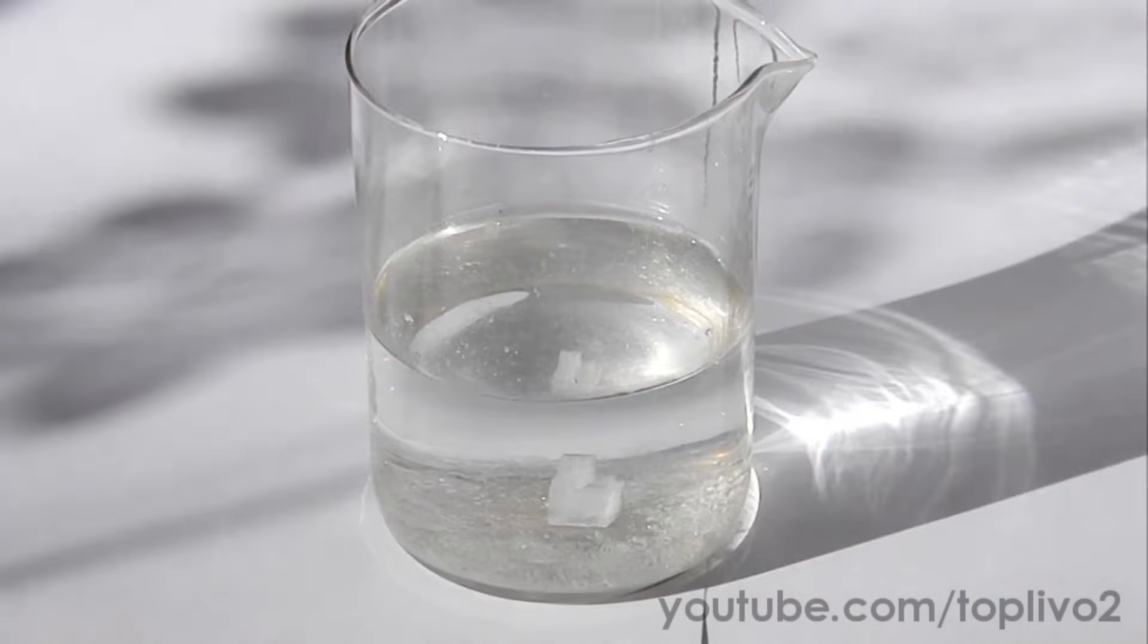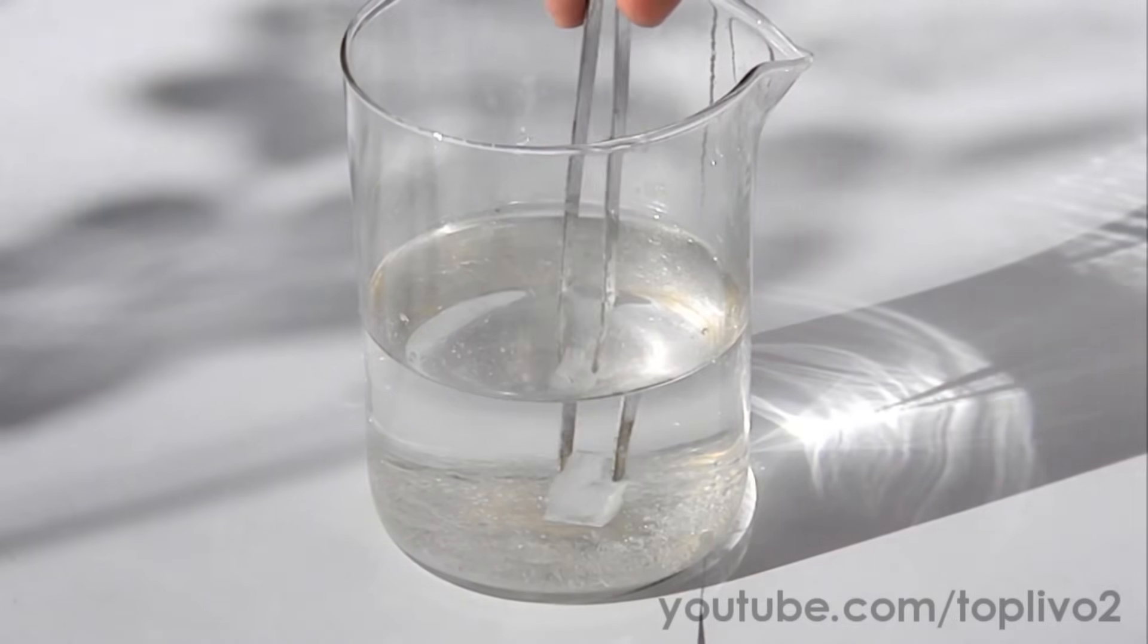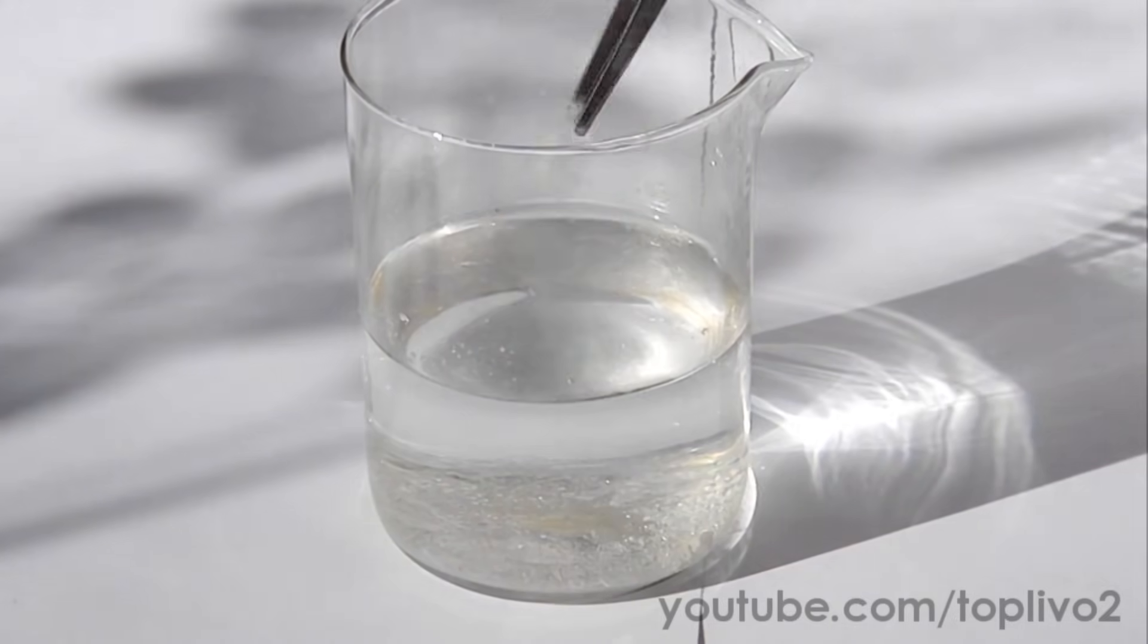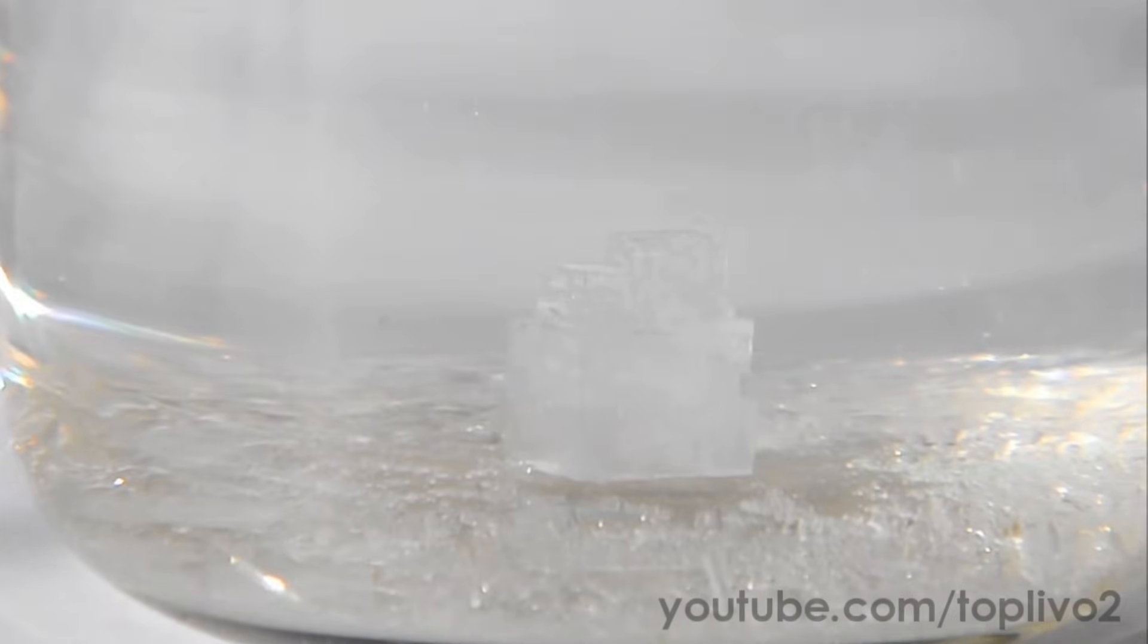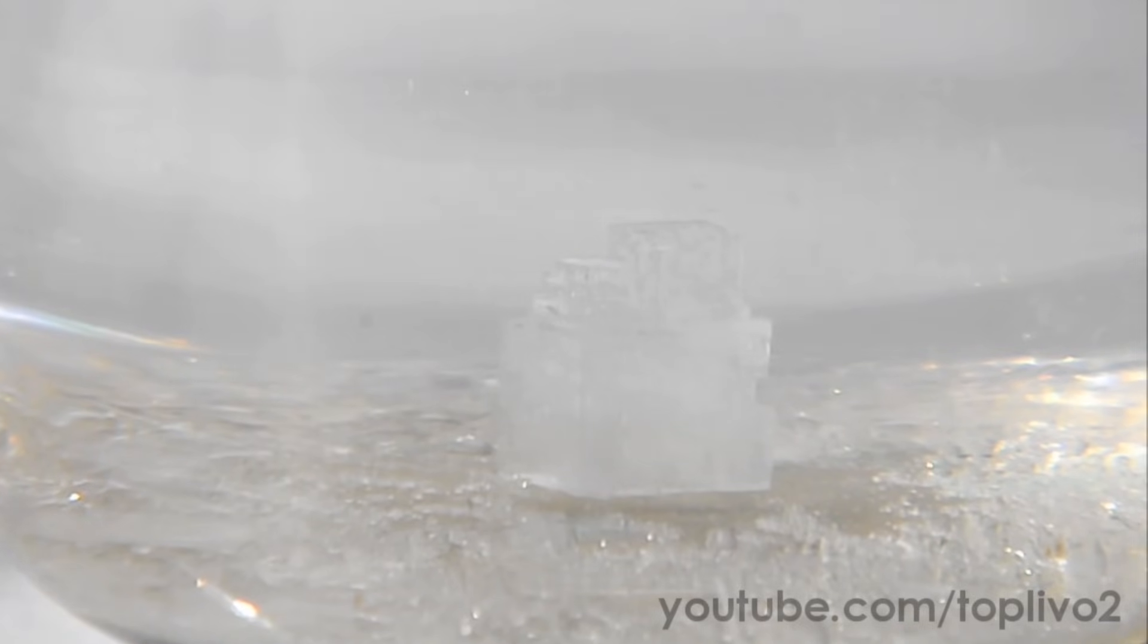When I was doing it before, I was also growing a crystal of a mixture of potassium chloride and sodium chloride in parallel with making the crystal of copper sulphate. This is 60% potassium chloride and the rest is just sodium chloride.